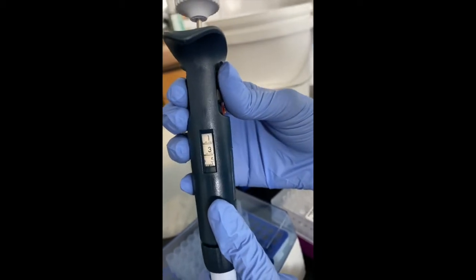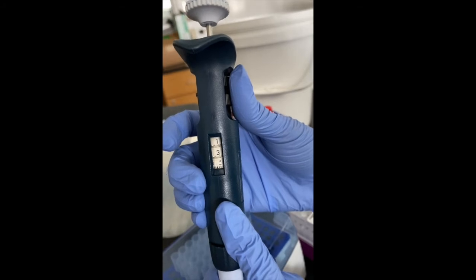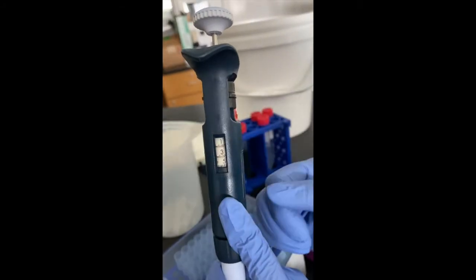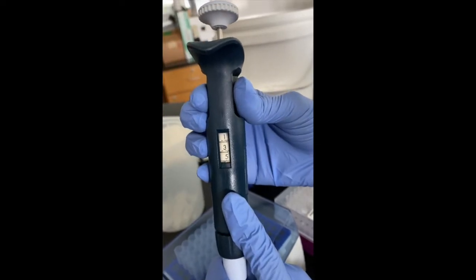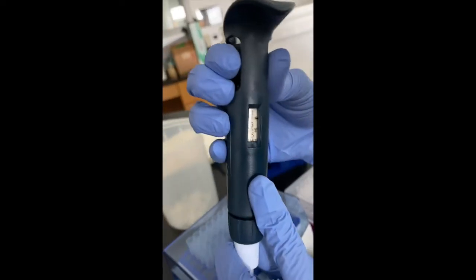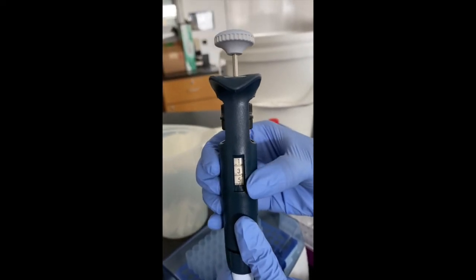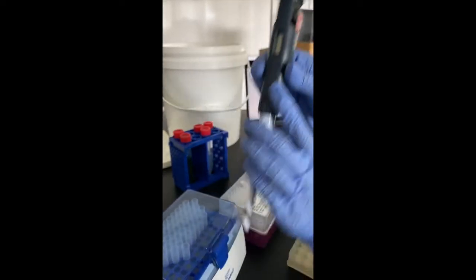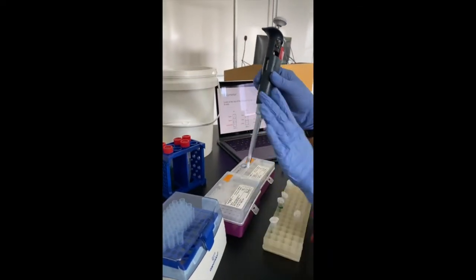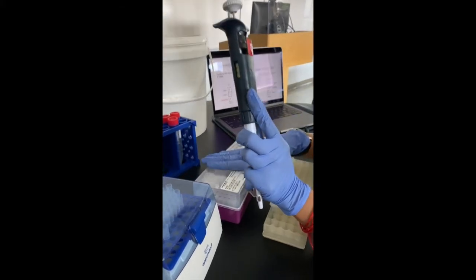So this now indicates 135.2 because the arrow points to the first micrograduation beyond the digit 5. So if you want 135.0, you have to ensure that the arrow points to the exact graduation below 5. So once you've set a specified volume, you have to choose the right set of tips. Once again, for P200, it would be the medium-sized tip.